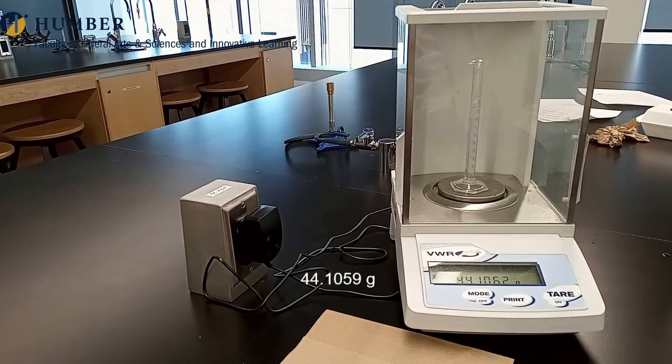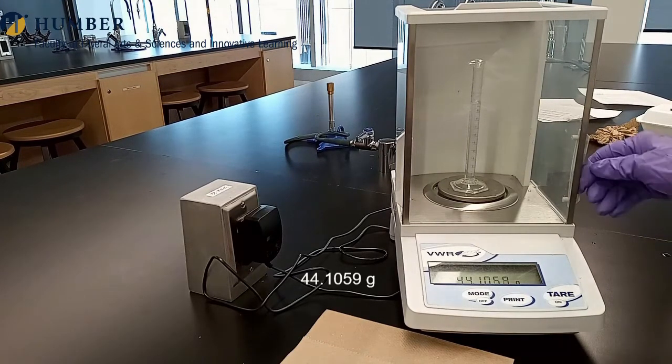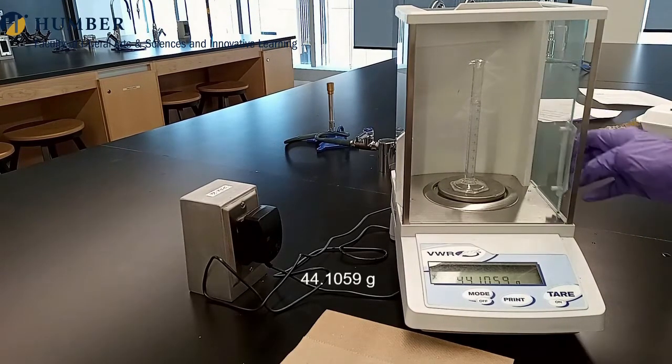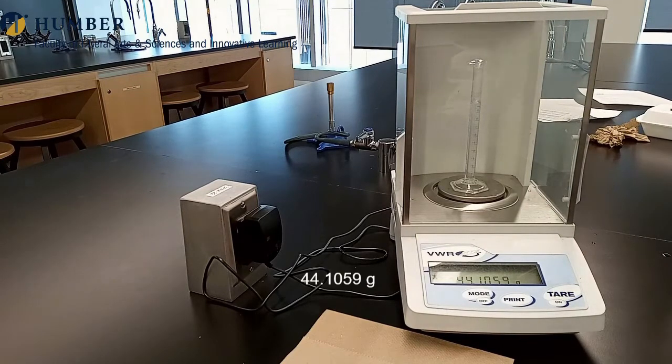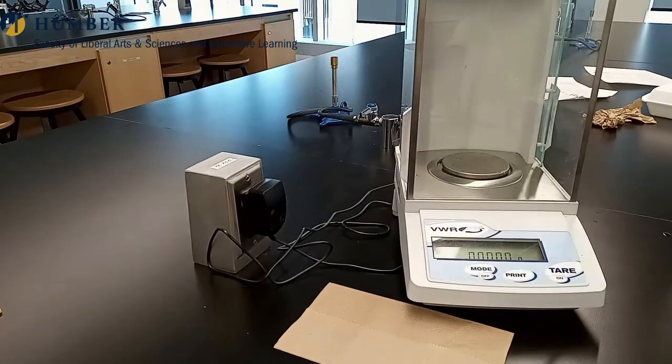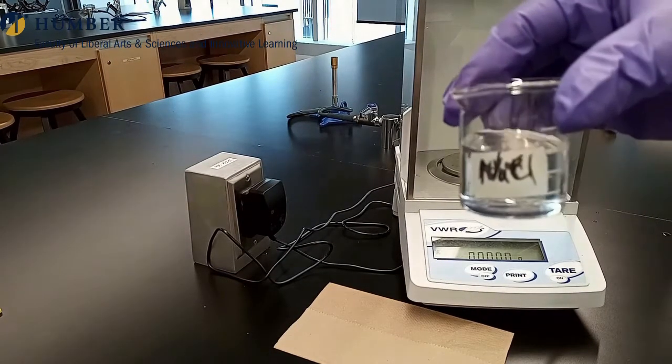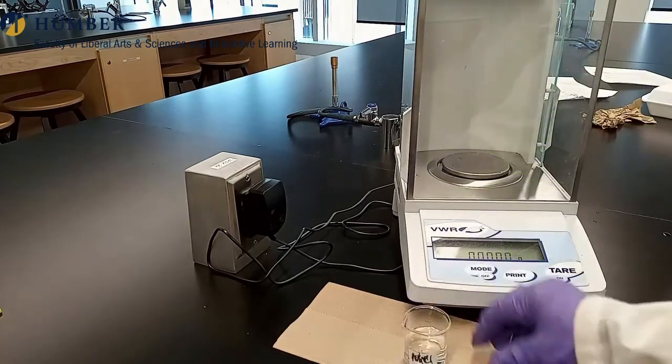Record all measurements in the appropriate spaces of the data table. Calculate the density of the liquids.